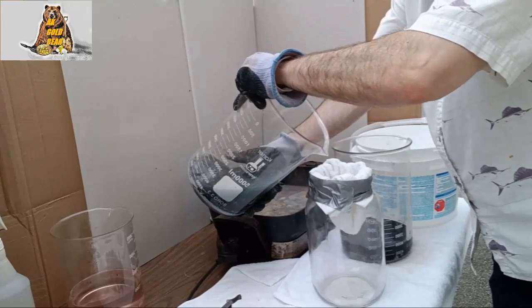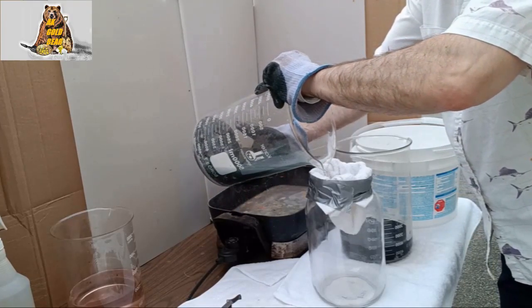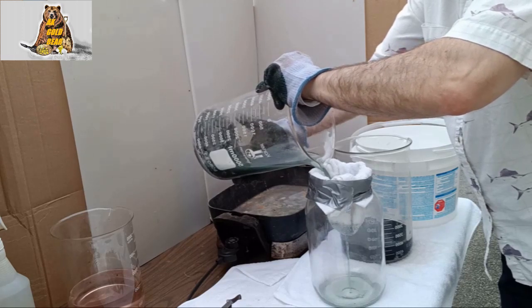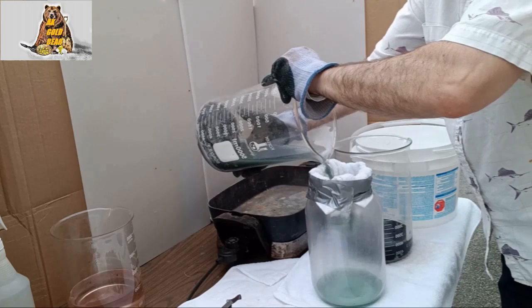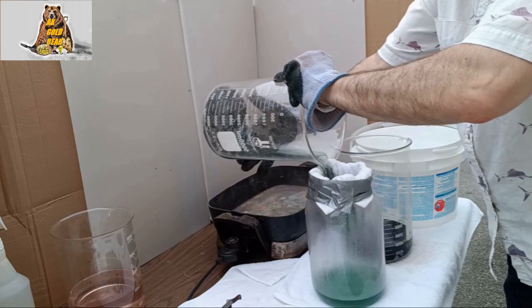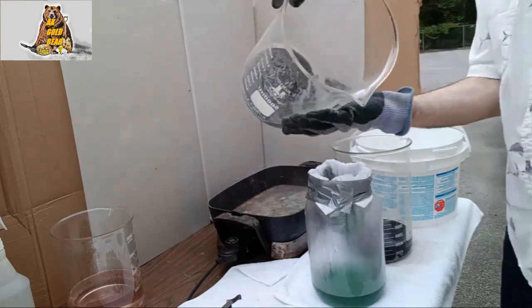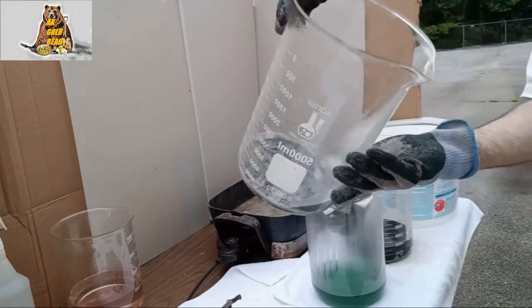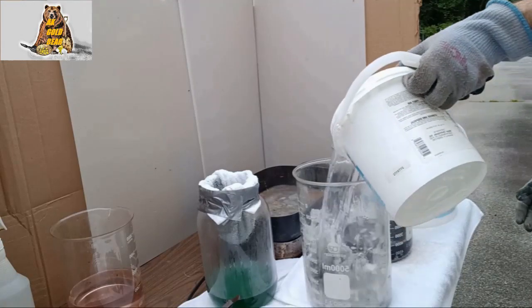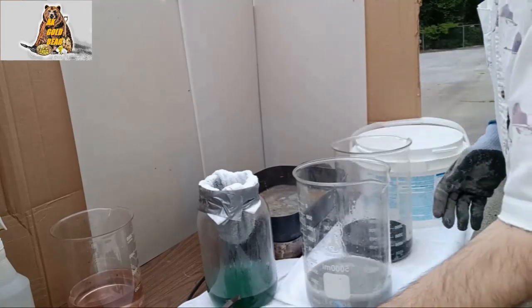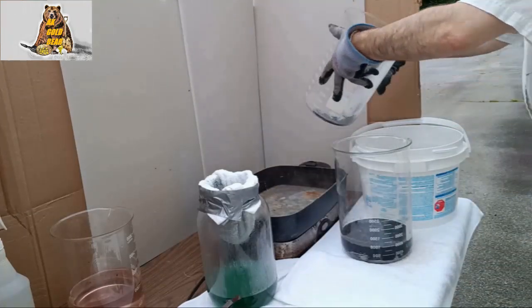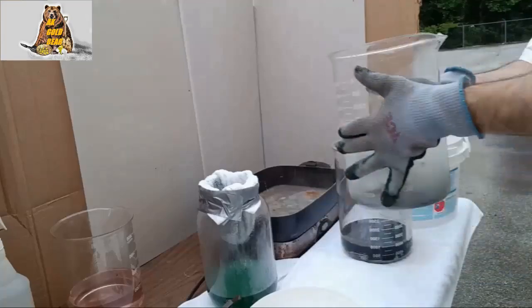Now I will keep my solution on the table around 5-10 minutes. 10 minutes enough. And slowly, just drain your solution to the filter. Wash with water.